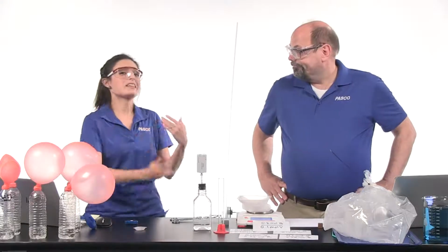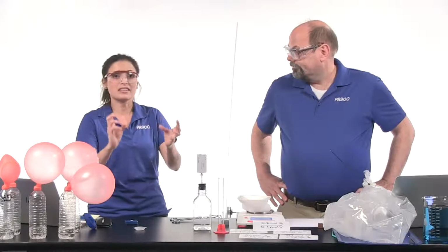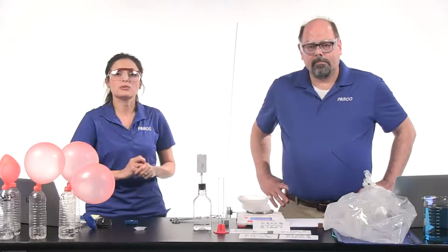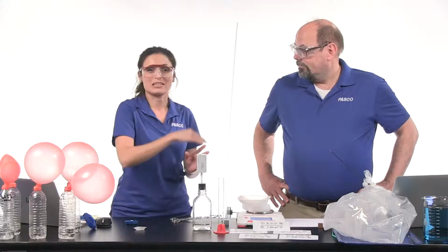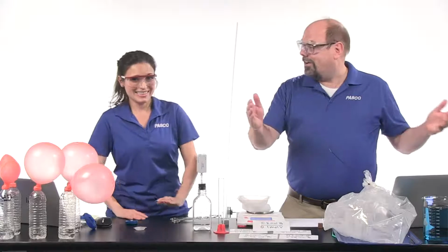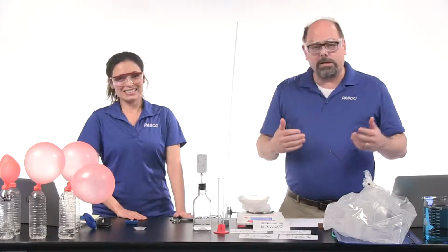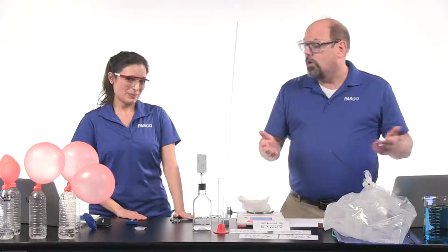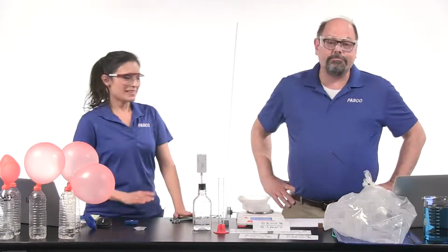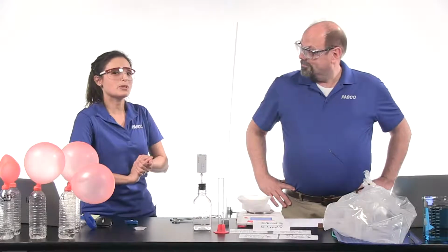So when students do the analysis, they go through and calculate the moles. We walk them through how they mathematically calculate that 3-to-1 ratio using the grams they started with way back in the beginning. And really, in the 1800s, this would have been your job as a chemist: to go through and figure out how different things react with one substance. Then they'd switch to another substance, and they really learned everything we know about the periodic table when they did these comparative reactions.